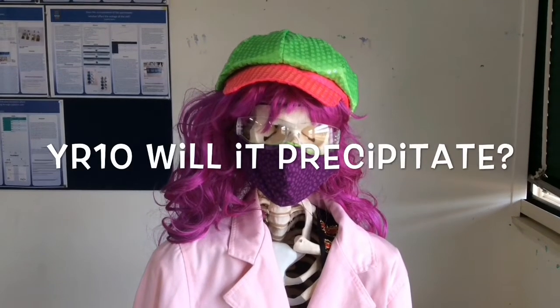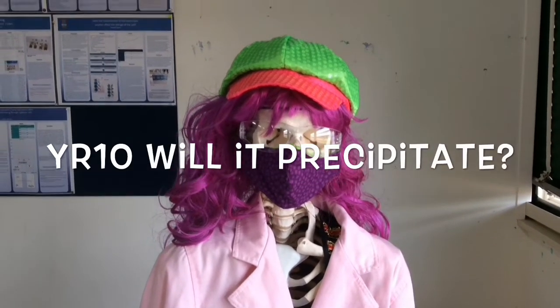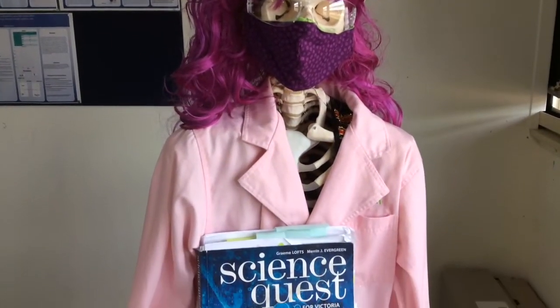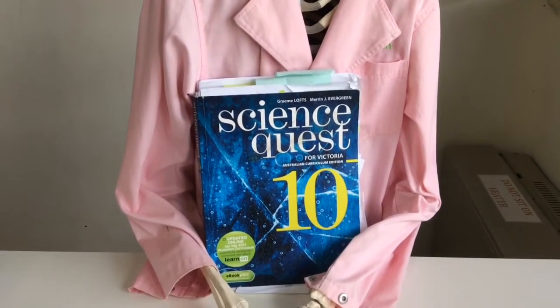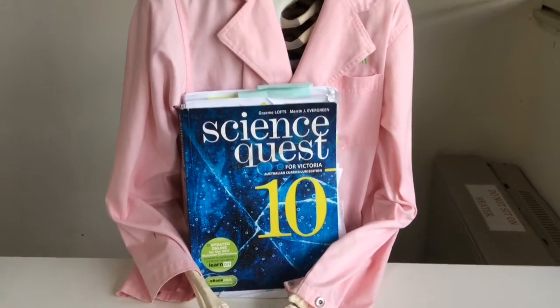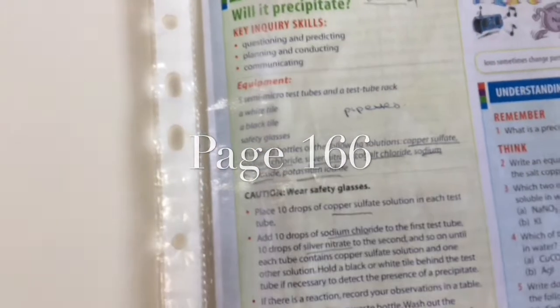Howdy, howdy, Year 10s. We're going to do an experiment. Professor Bones is going to help me out here. You will need your textbook. We're going to do the experiment, will it precipitate? You'll find the experiment on page 166.